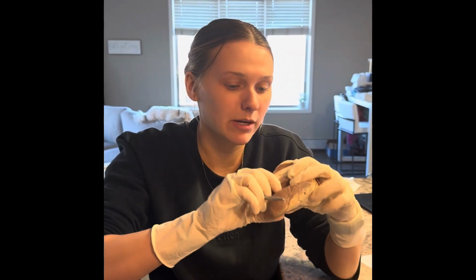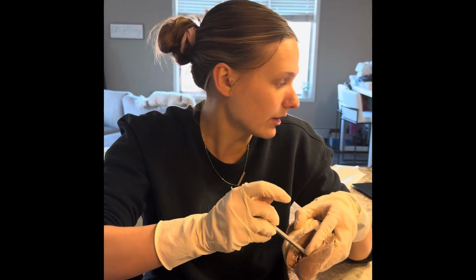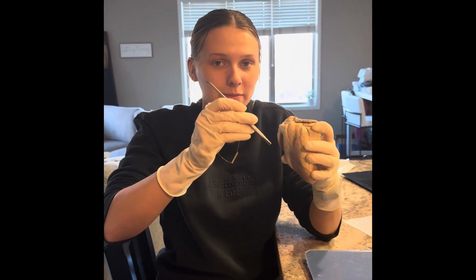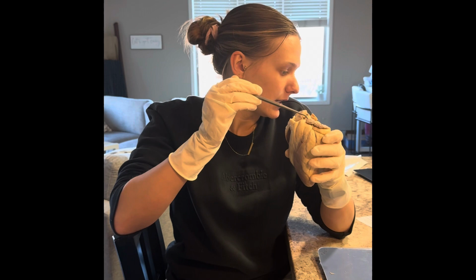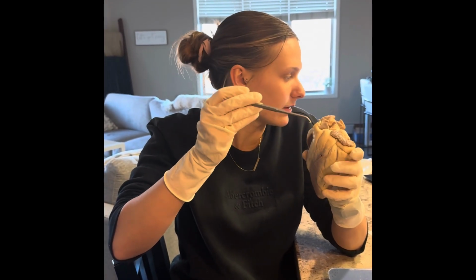Next, I'm going to talk about the papillary muscle. So that falls within the left ventricle right in here. The papillary muscle is the muscle anchoring the chordae tendineae to the valves. Okay, so the next thing I'm going to talk about is the semilunar valve. And the semilunar valve, there are two of them, and they fall up here. It's the aortic semilunar valve and then the pulmonic semilunar valve.